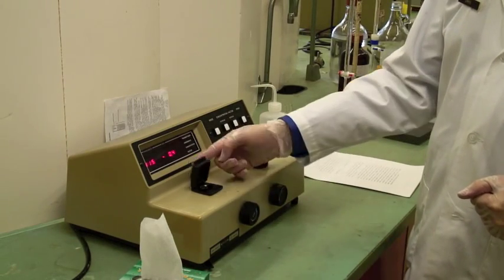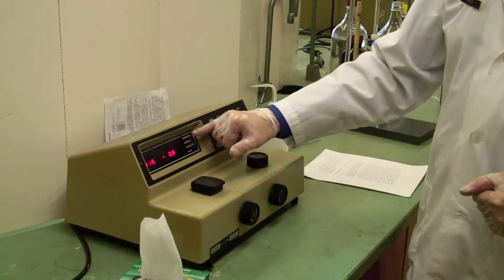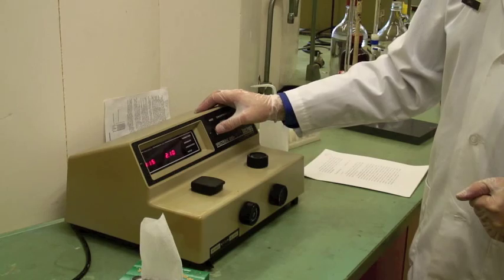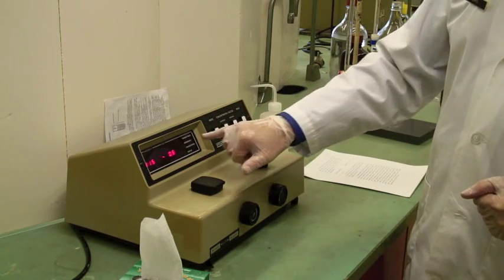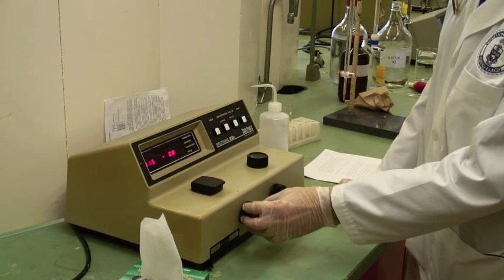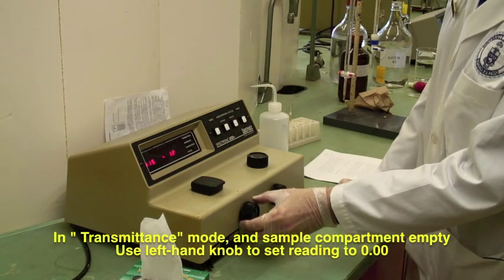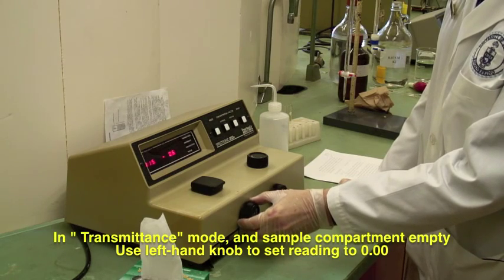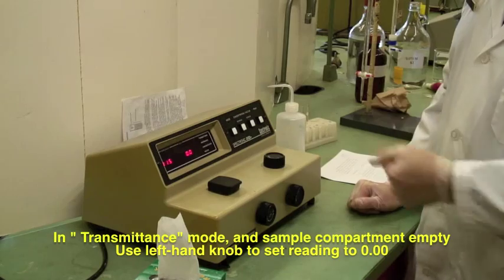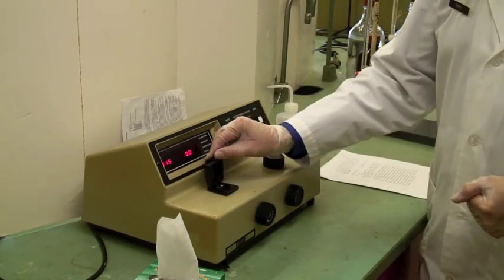At the moment, as you can see, there's nothing in the sample container. With this set to percent transmittance — you can change the mode with this button — you want to have it in percent transmittance and use the left-hand knob to set it to zero. We're telling the photo cell that this is what blackness looks like, that it should give a zero reading for this.